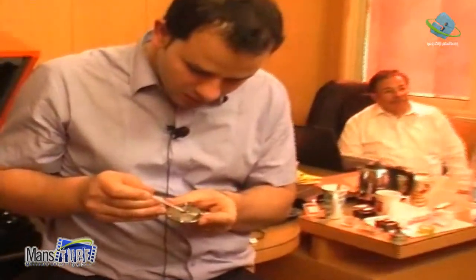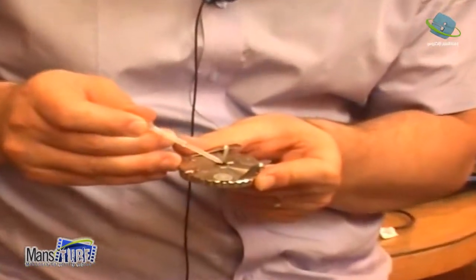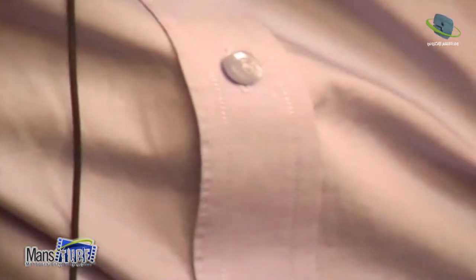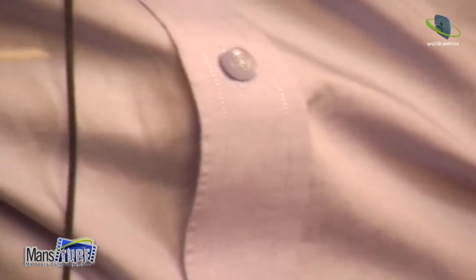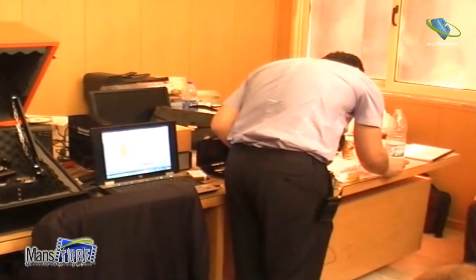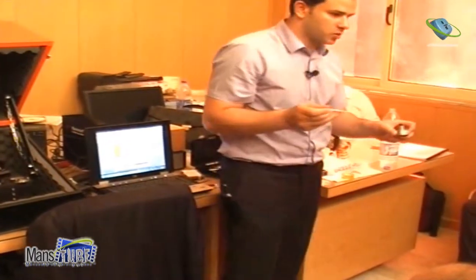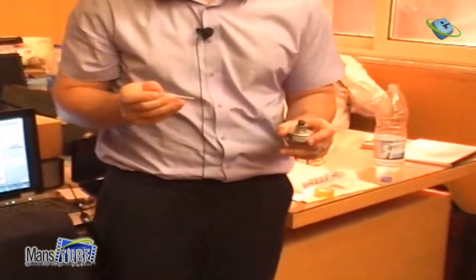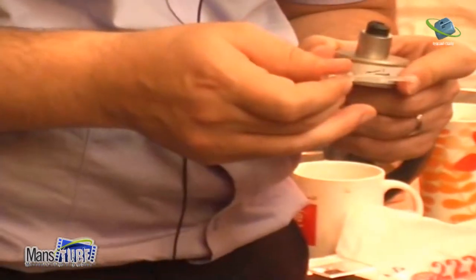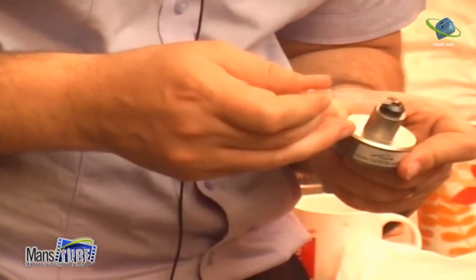Okay, and now I will take another one here. I can put also something like that. Okay, also a drop of water. And now I have my water. Another step, what I do, I will put also water on this one. Okay, because now I have, let's say, a limited quantity of water. There is not too much. And now I put usually here also a droplet of water.